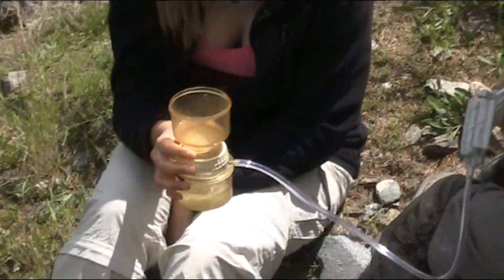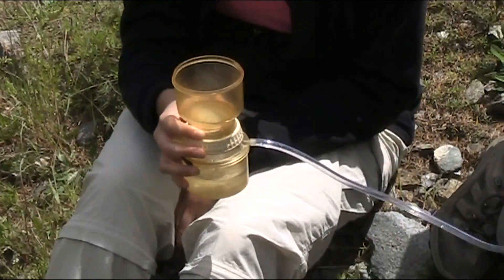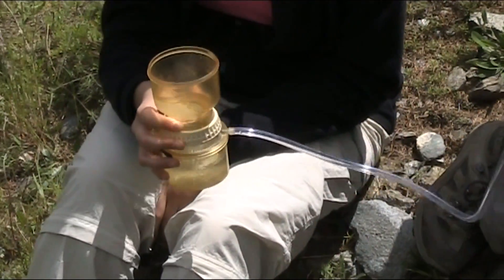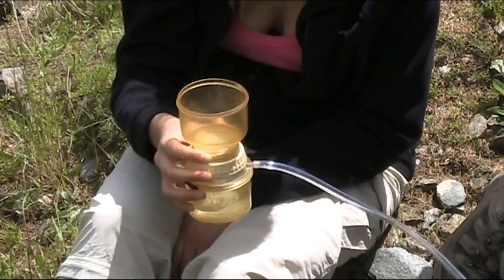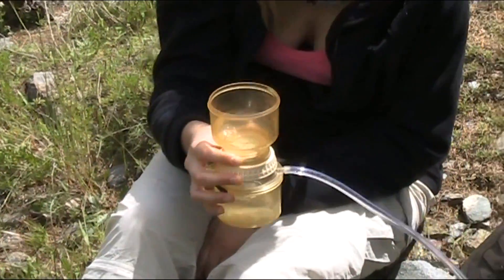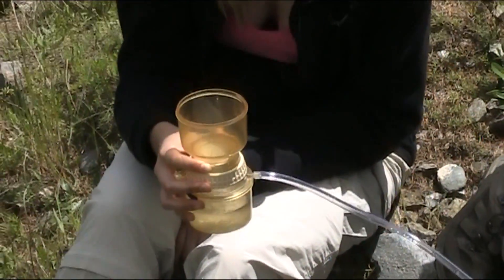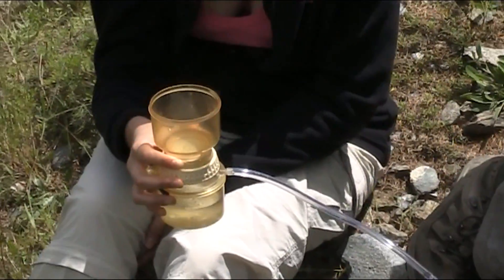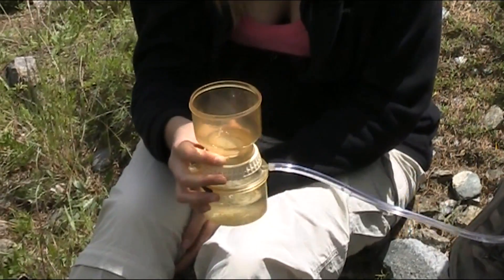One handy tip — a very important tip in fact. When you're getting close to the end of your sample, give the vacuum flask a bit of a swirl. Make sure you're getting all that sediment off the sides of the upper chamber that may be trapped there. It's very important you do that as you get to the end, to make sure you're getting all that sediment onto the filter paper, and that the end result when we weigh the dried filter paper is as accurate as possible.